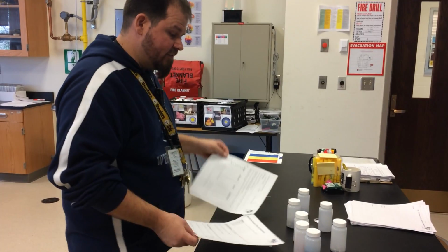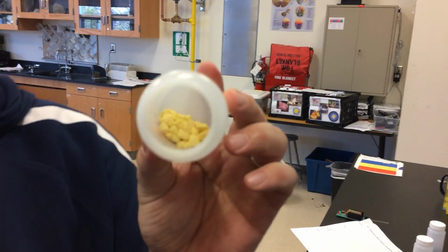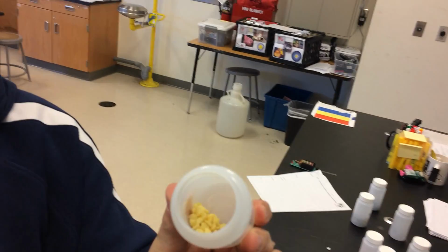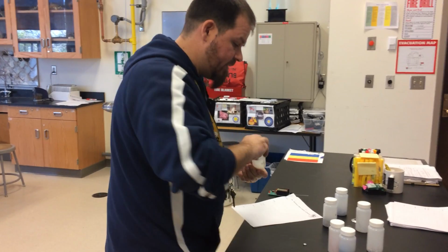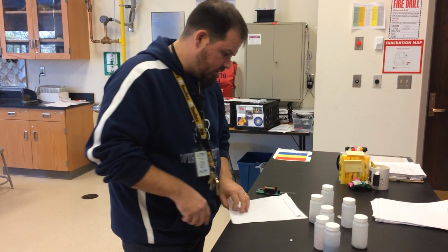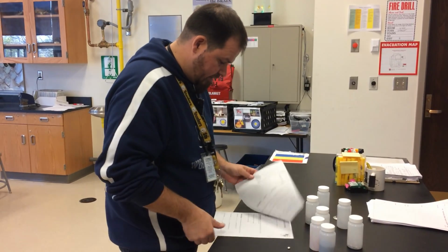There are not a lot of some of them. Like here, check this one out. There's not a lot of this stuff. So you can't use a lot of it. Okay, we're just going to use a little bit of that. So we're going to have to keep that in mind, that we've got two full classes that need to go through this stuff. When we're done, we can put it back where it belongs. I will do that in a second.